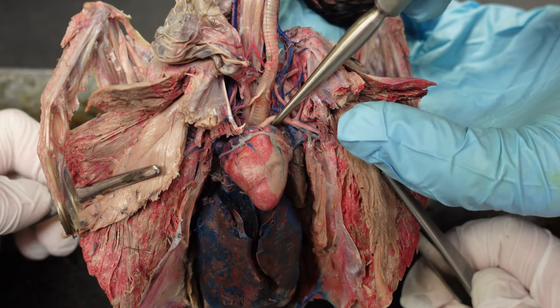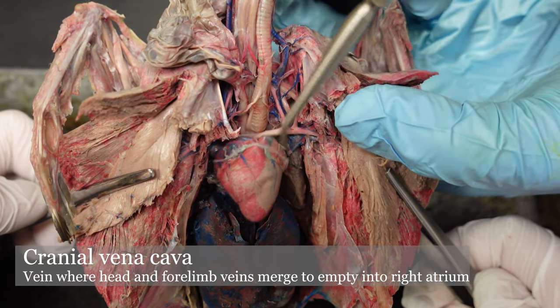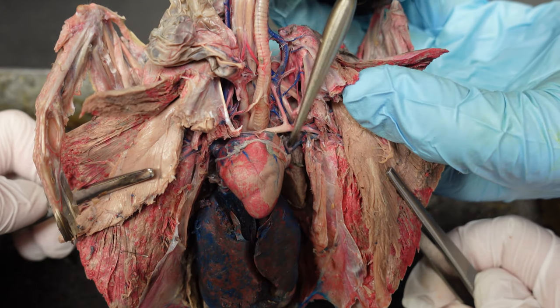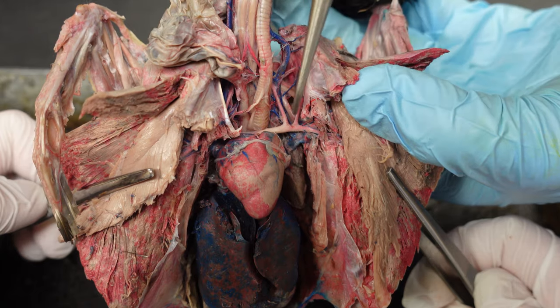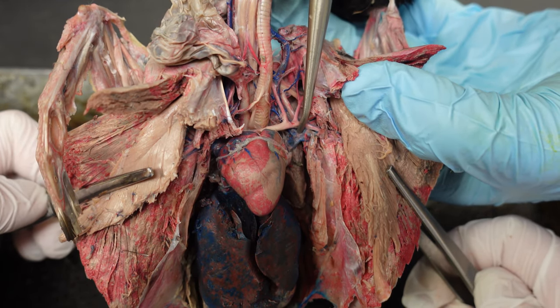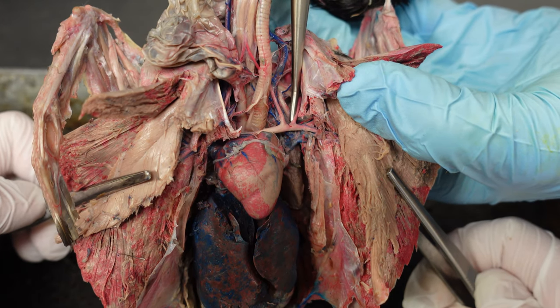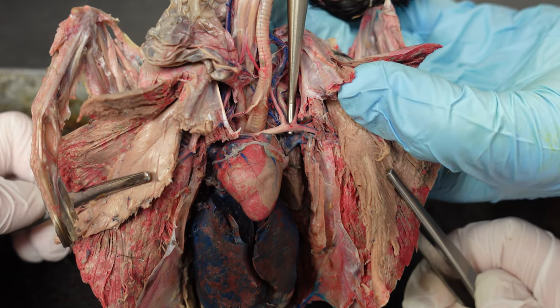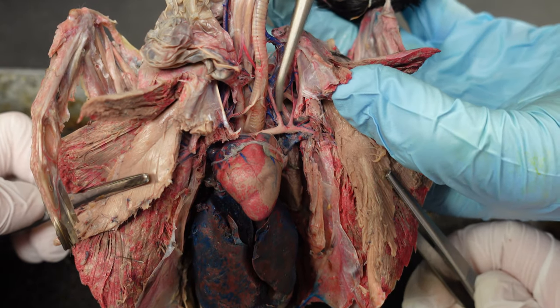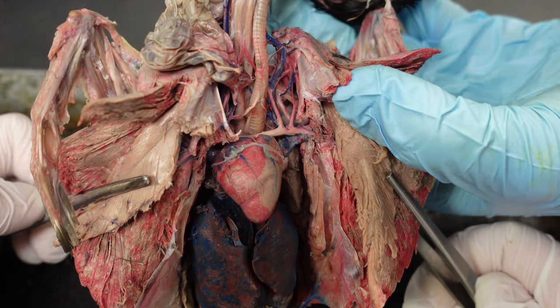I should also point out the cranial vena cava is right here. Then below that, where that external jugular vein branches off, we have the subclavian vein. It can be kind of hard to see because that external jugular vein is branching off beneath the subclavian artery.